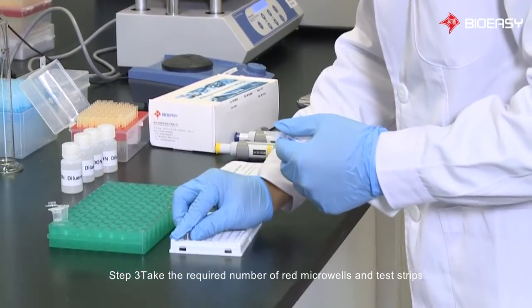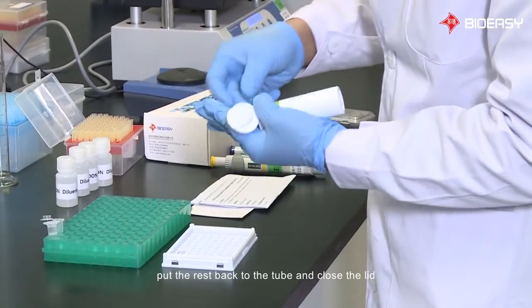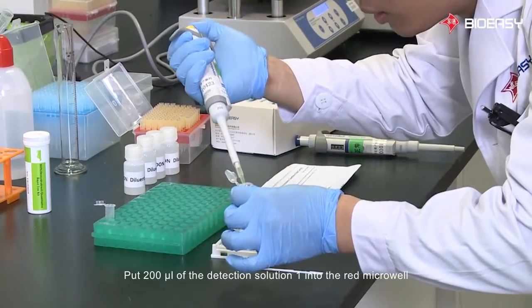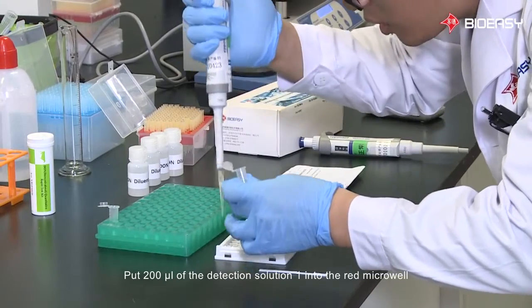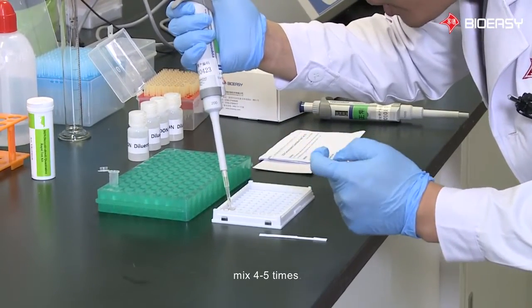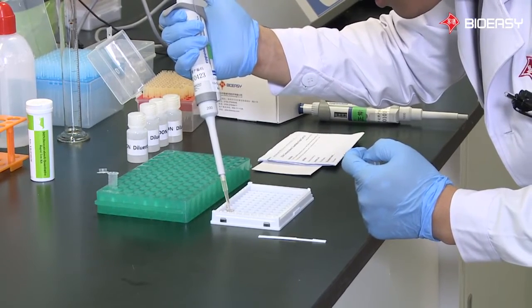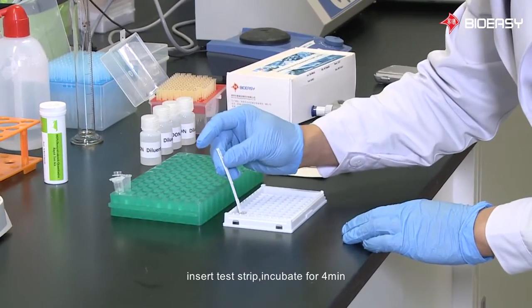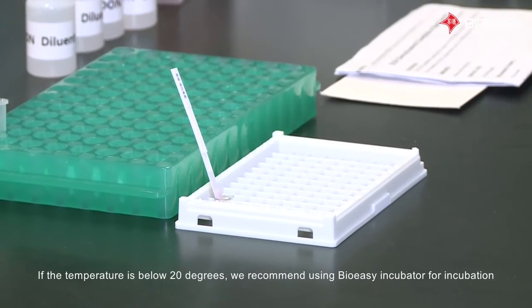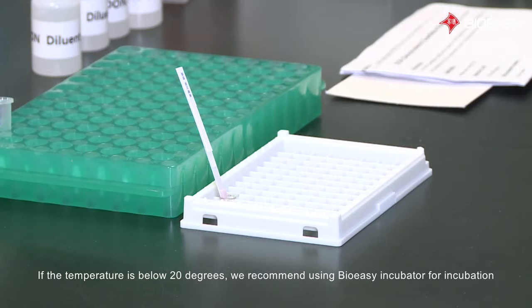Step 3. Take the required number of red microwells and test strips, put the rest back to the tube, and close the lid. Put 200 microliters of the detection solution 1 into the red microwell. Mix 4 to 5 times. Insert test strip, incubate for 4 minutes. If the temperature is below 20 degrees, we recommend using Bioeasy incubator for incubation.